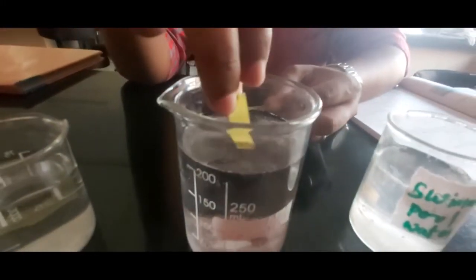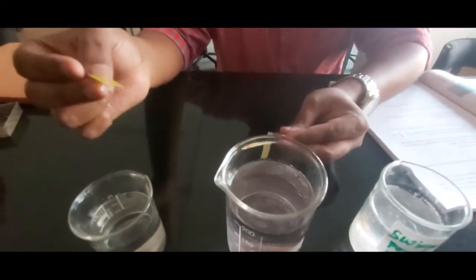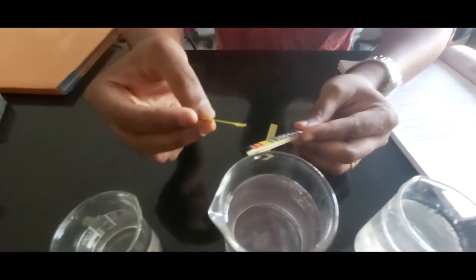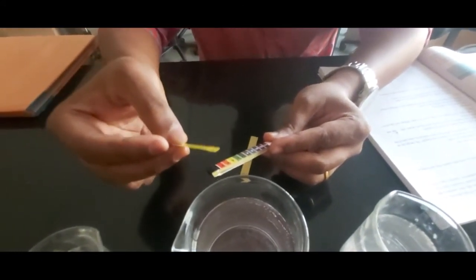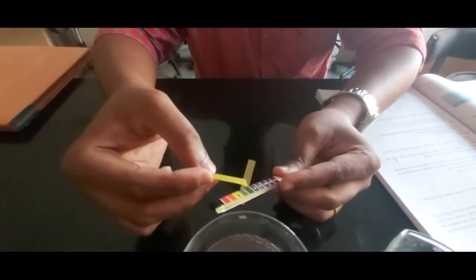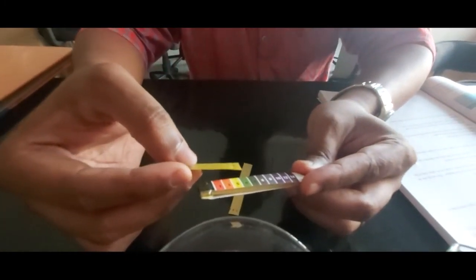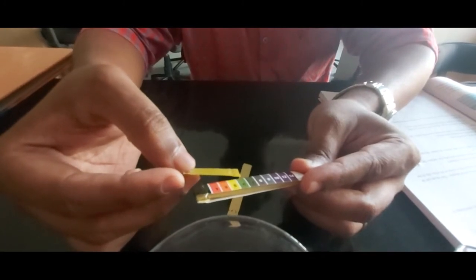By default we are supposed to write the pH for distilled water as 7 — that is neutral — because it does not contain any dissolved salts in it. The second water sample is tap water. For this particular tap water there will be a slight change compared to distilled water, because this tap water comes from reservoirs, dams, or nearby lakes and ponds, which may contain pollutants or contaminants. So it may show a reading of about 6.